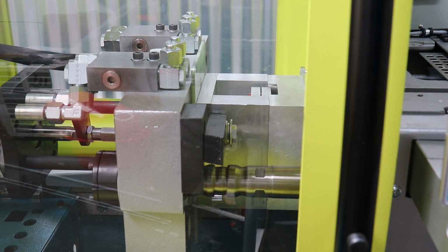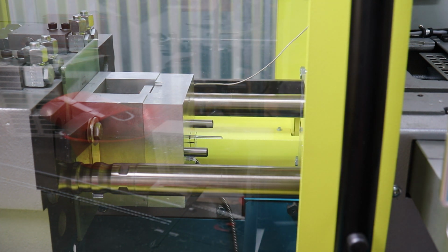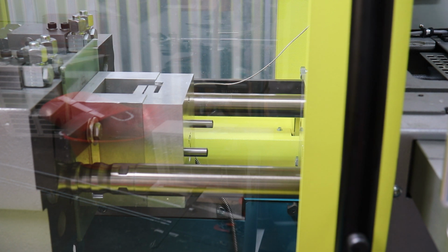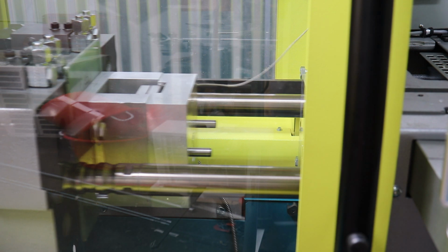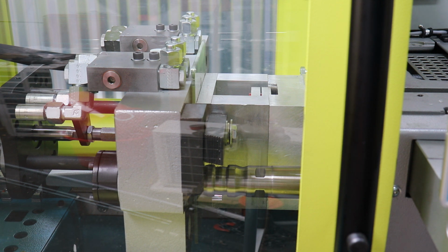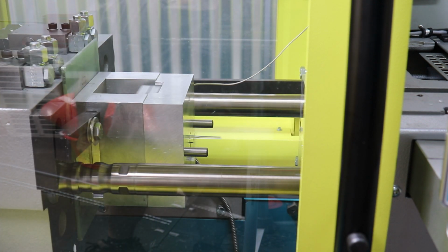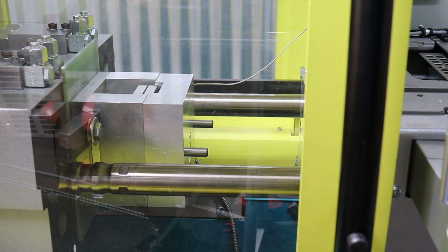I reduced the pressure for ejecting forward as well. Oh, yeah, I couldn't make it. It's trying to push farther than it can. So I'll tell it 9.3, and I'm in manual mode, so let's back off, eject forward. Yeah, it's just getting hung up in that little, there it goes. Another thing, it's already doing 4 ejections. All right, I may have to make a slightly longer ejector pin in the middle, the sprue ejector pin. But let me get a triangular file out and see if I can do some magic. Yeah, with 4 cycles it'll do it.